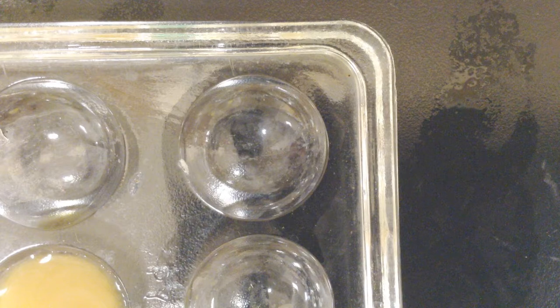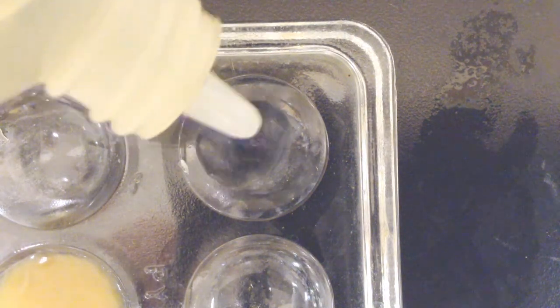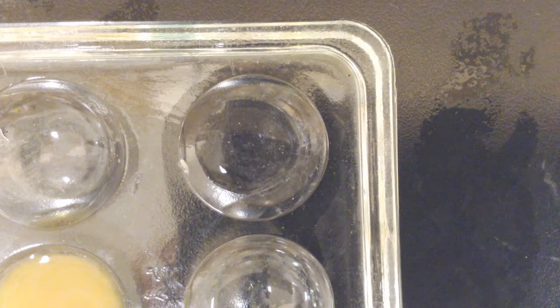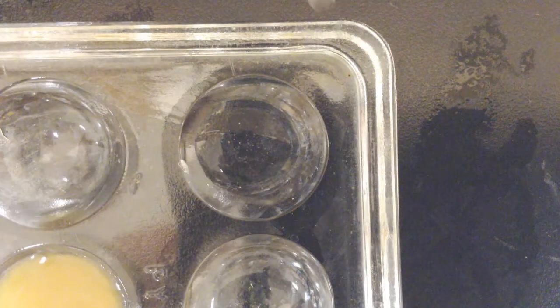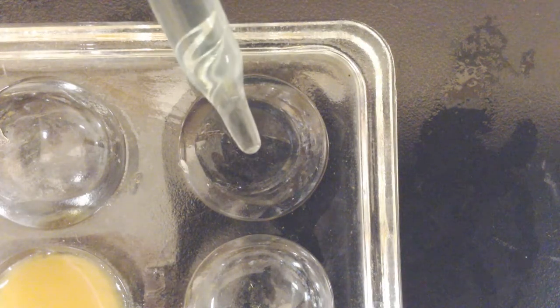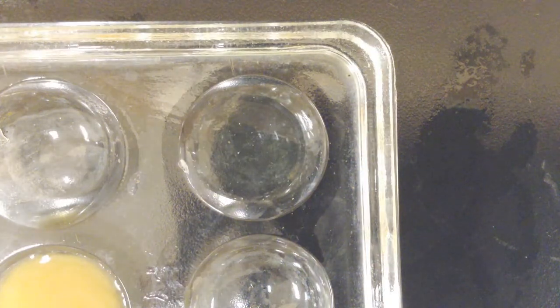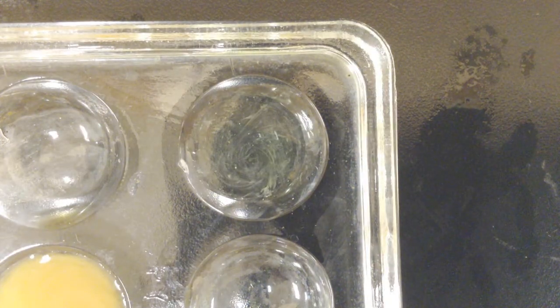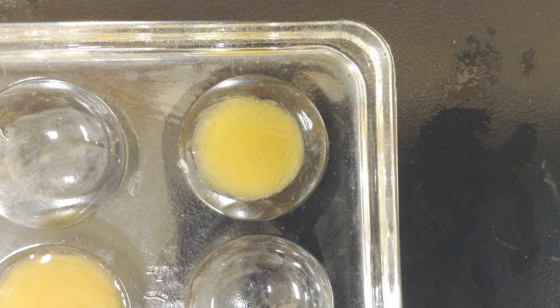I just want to try to get a close-up view of what is happening in this reaction plate. Again, this is iodide, I1-, and I'm going to add some copper 2+ to it. And watch what happens when these things mix. That's just awesome, solid precipitate formation.